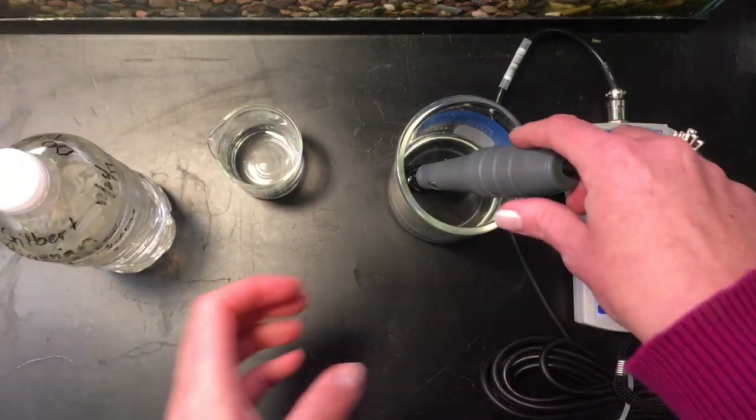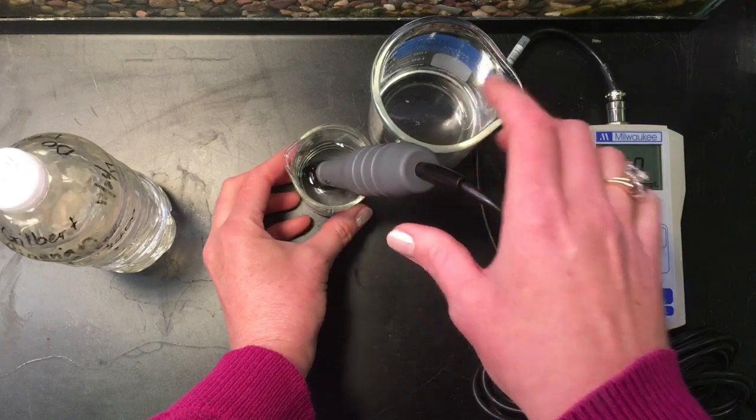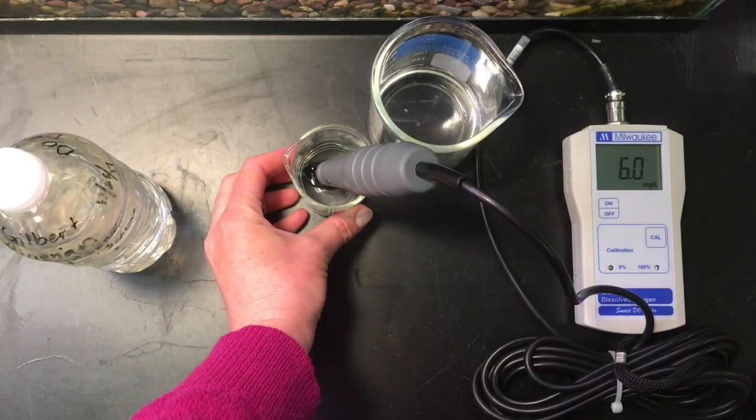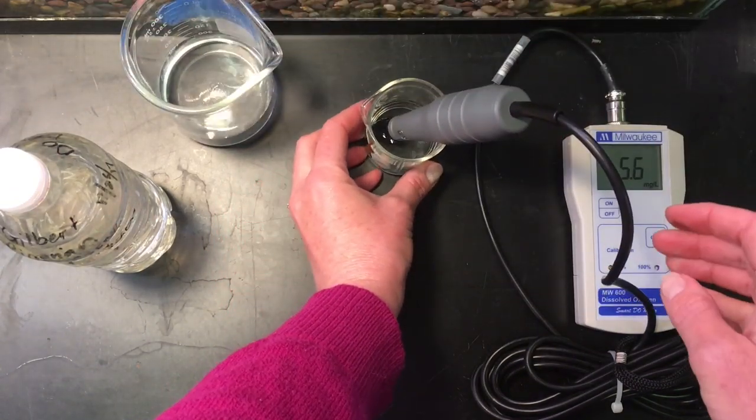And now I'm going to take my measurement here and leave it for about a minute. And we'll grab the reading once it stabilizes in about one minute.